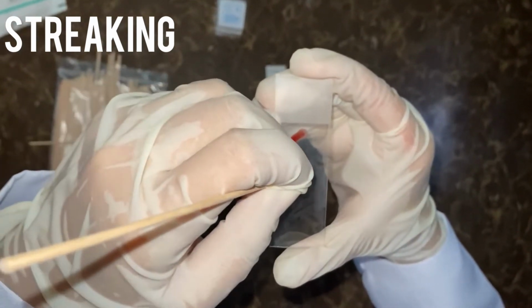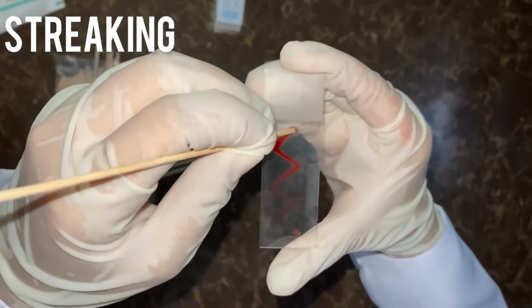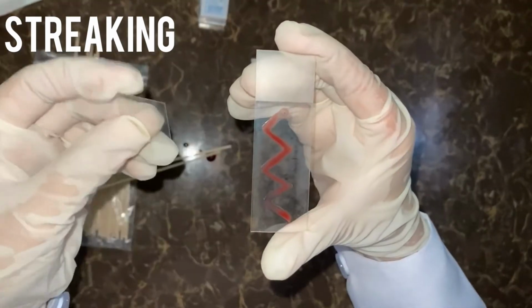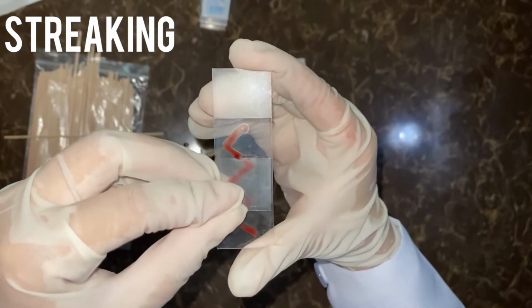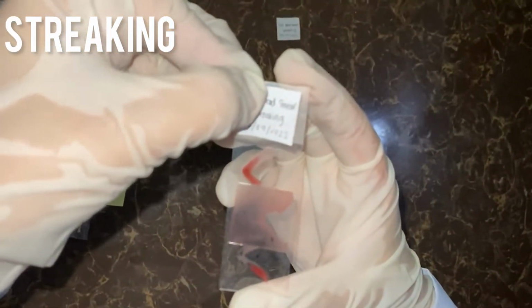A relatively uniform distribution of the material should be obtained. Third, cover it with a cover slip. Fourth, label the slide.